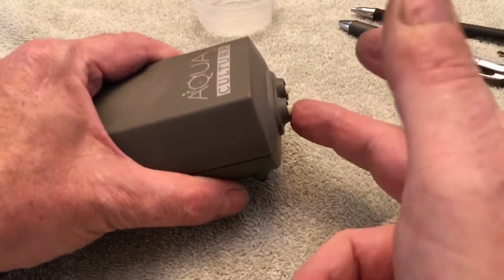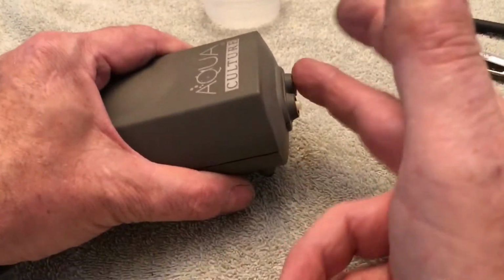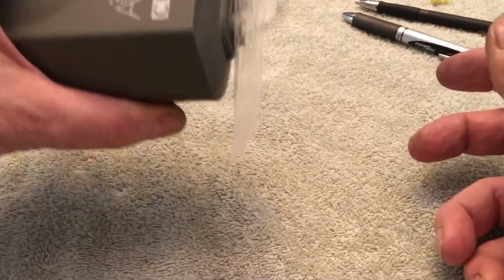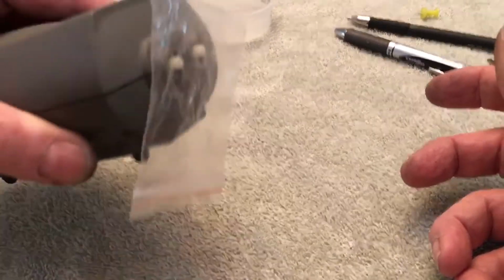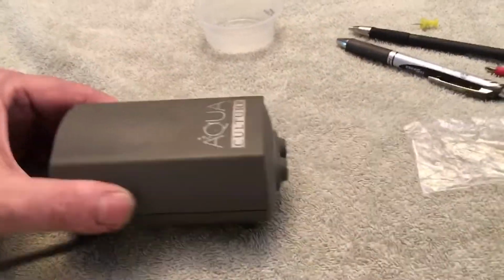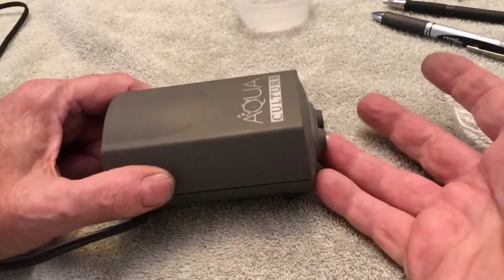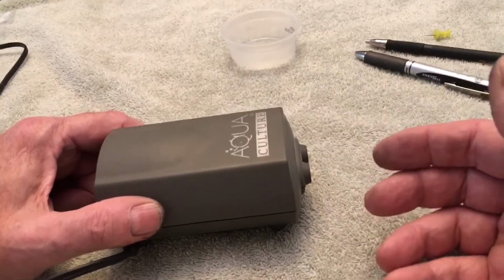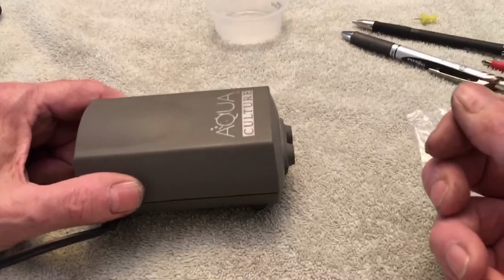If you wet your finger, you can feel it's not a tremendous amount of suction, but it is definitely a vacuum pump. And word of warning, with vacuum, kids are going to immediately want to suck up liquid or something, and that will destroy this pump.